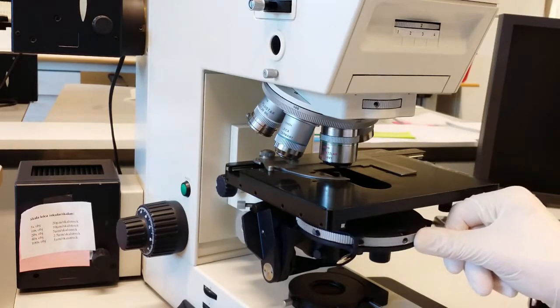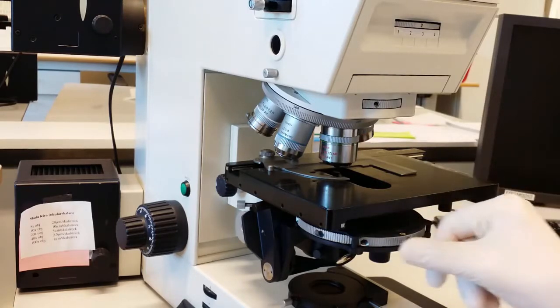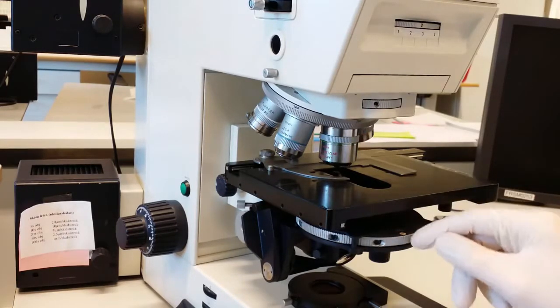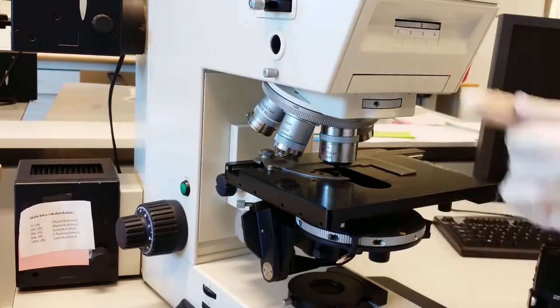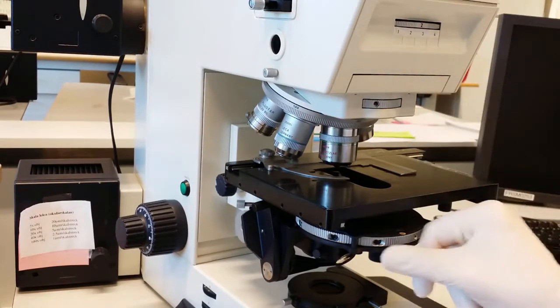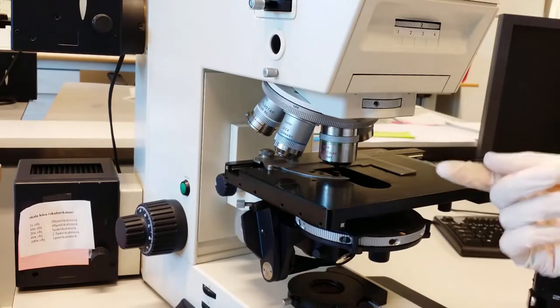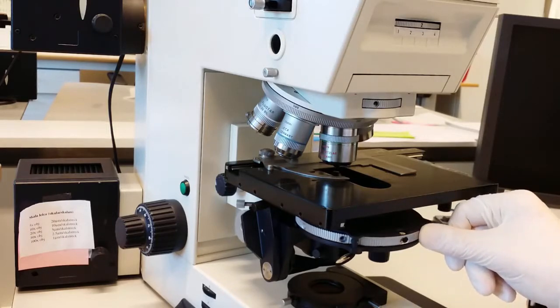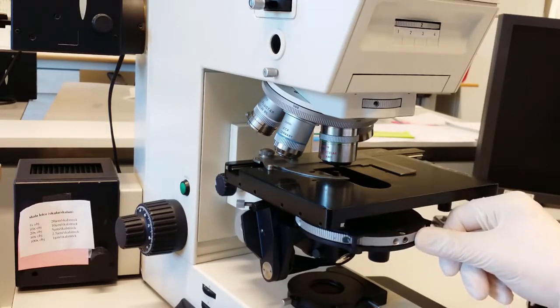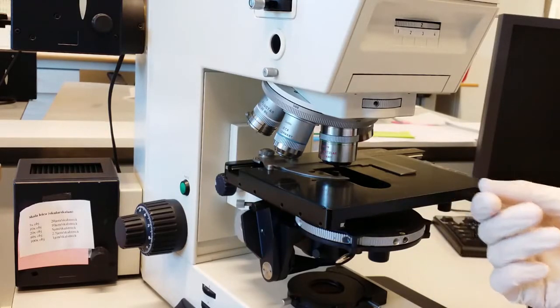Usually you have different apertures that match the objective. So here it says D, that's for the dark field imaging. Here it says 40, and that's used for differential interference contrast. Then you have the 40 times objective. Same thing here, 10, 20, that's for the 10 and 20 times objectives. 5, and this H is just for standard bright field imaging, so that's basically no aperture.